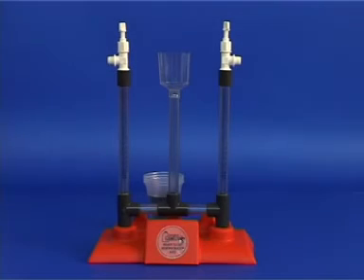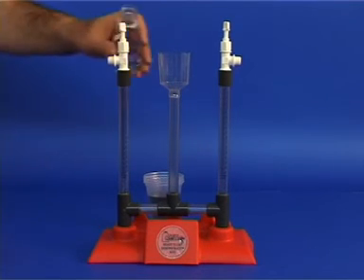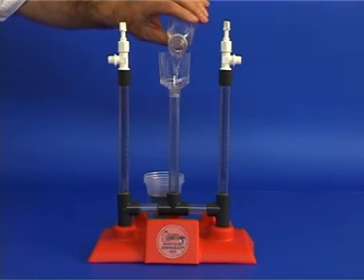At the end of the experiment, collect the sodium sulfate solution into the bottle and store for further use. Wash the apparatus with water and, if necessary, with alcohol and dry before storing for future use.